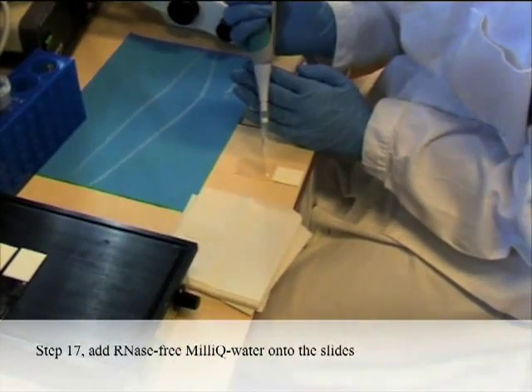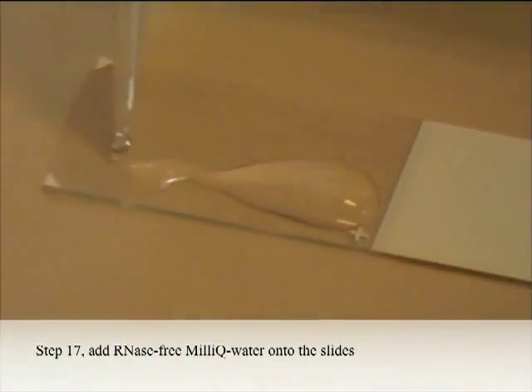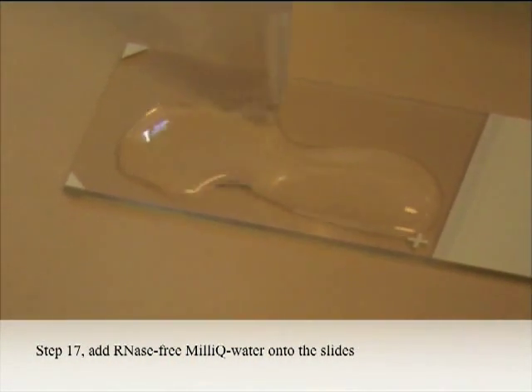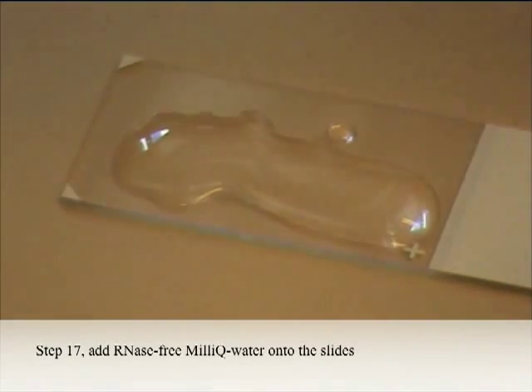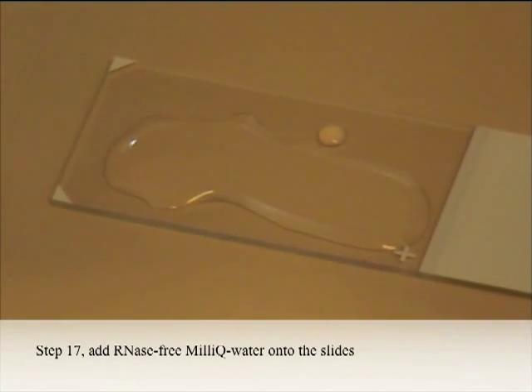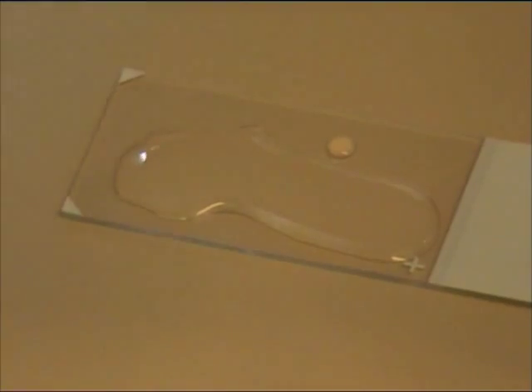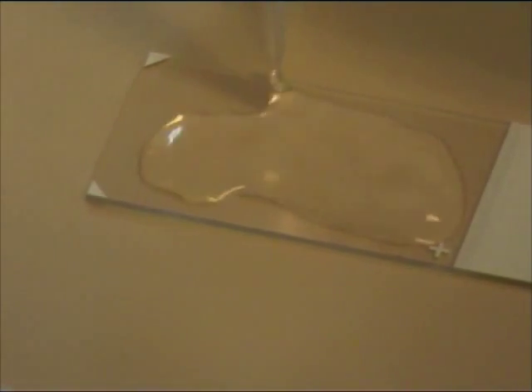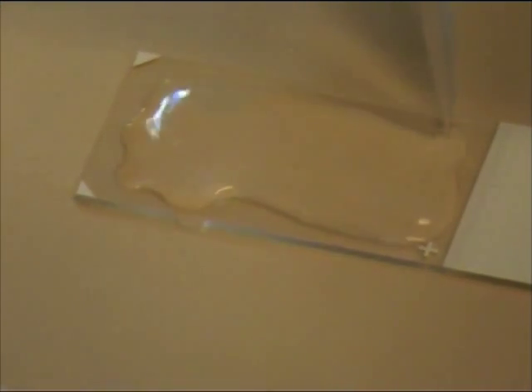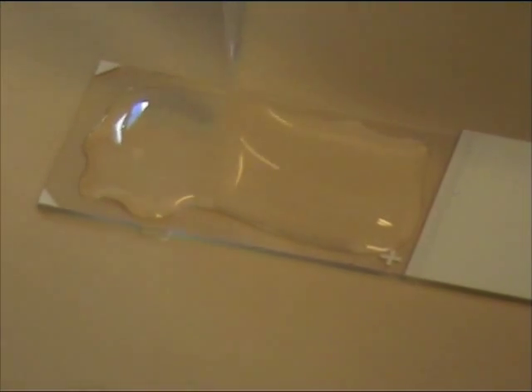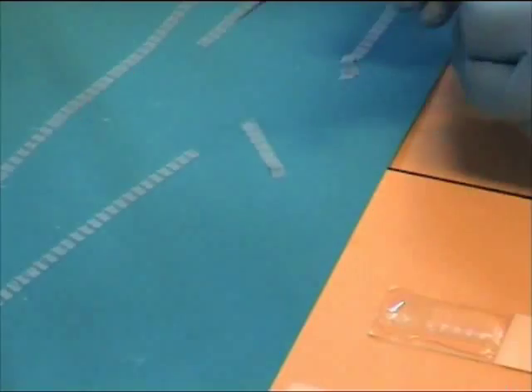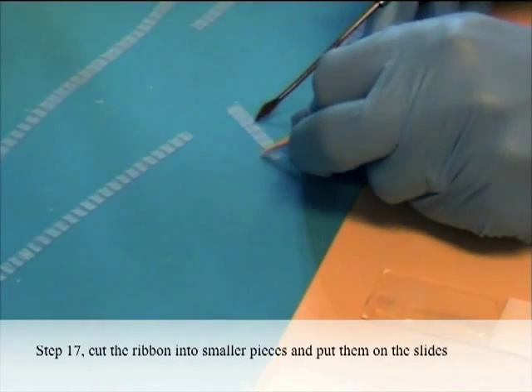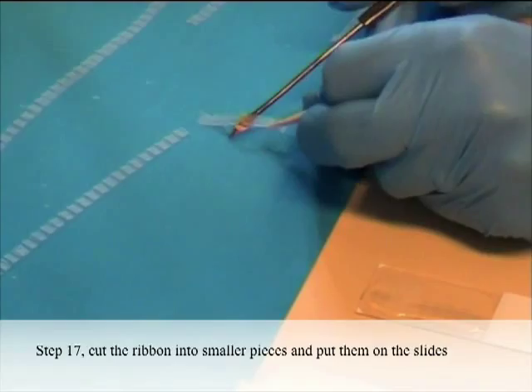Step 17: Add RNase-free MilliQ water onto the slides. Cut the ribbon into smaller pieces and put them on the slides.